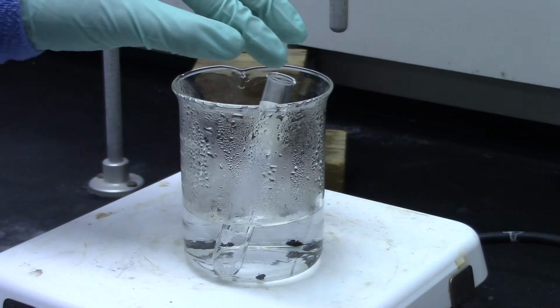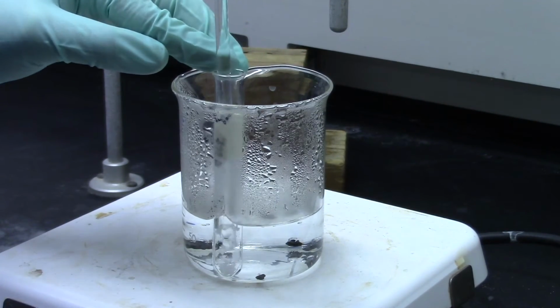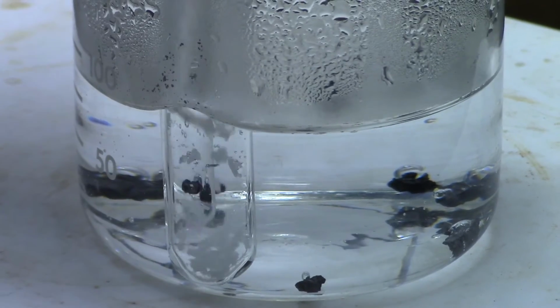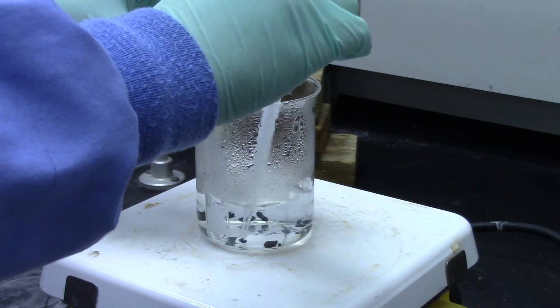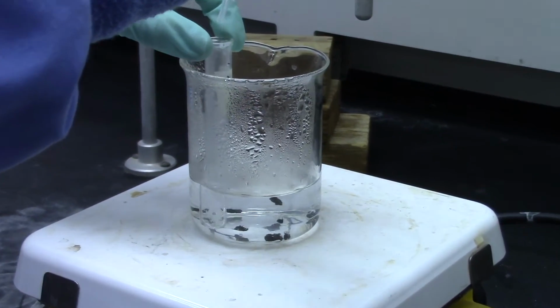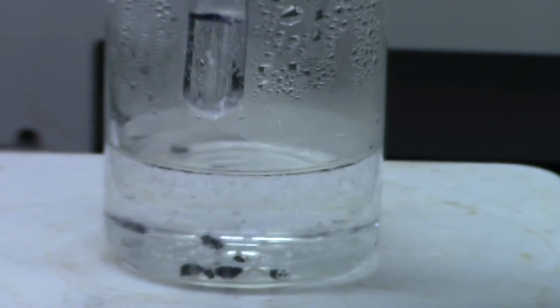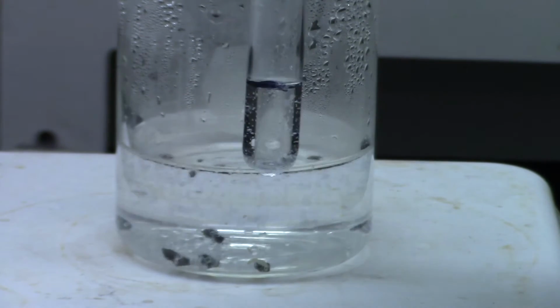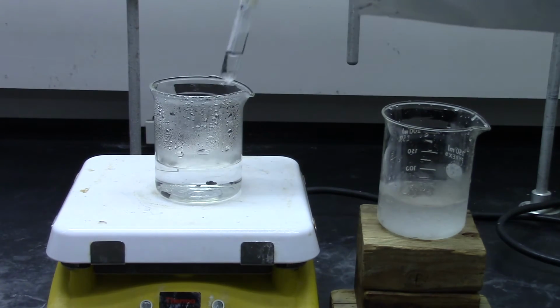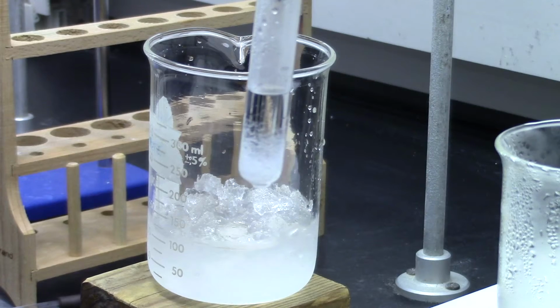Occasionally, shake the tube and boil until all the solute is dissolved. If needed, you may crush benzoic acid chunks with a glass rod to aid dissolution. You may also add up to 1 milliliter of hot water straight from the bath to the test tube if benzoic acid is still undissolved. Once dissolved, take the test tube from the hot water bath and place it in the ice water bath. Observe rapid formation of the crystals.